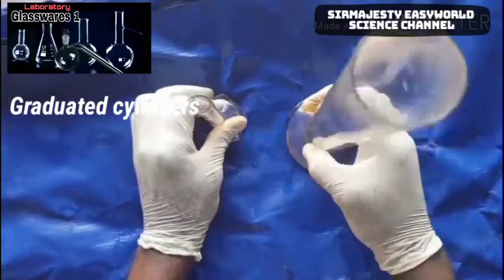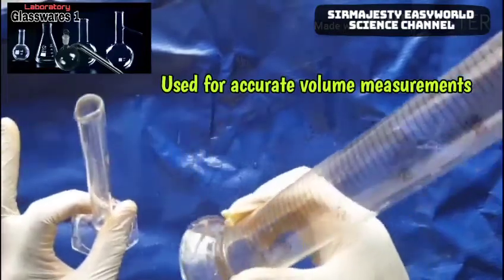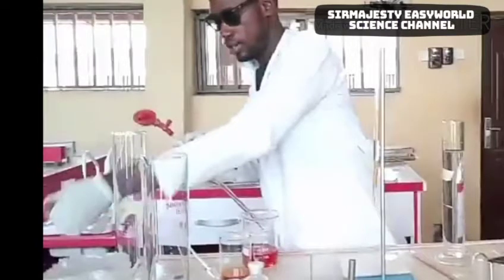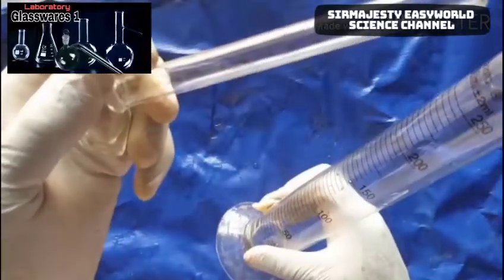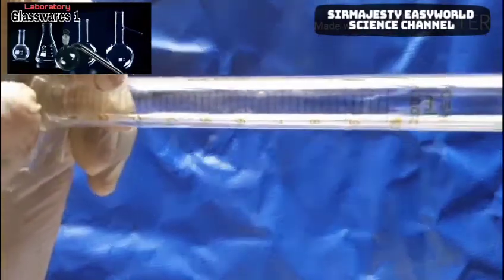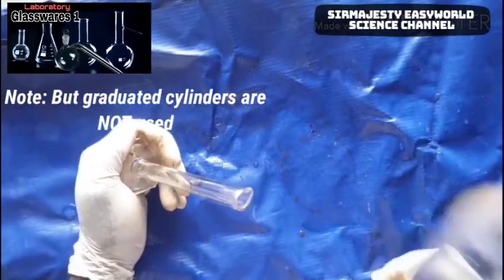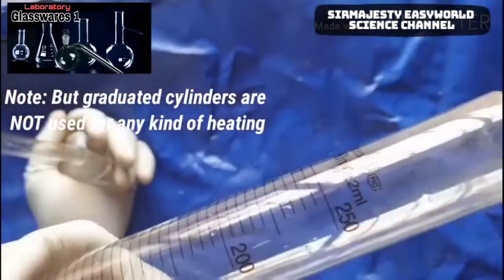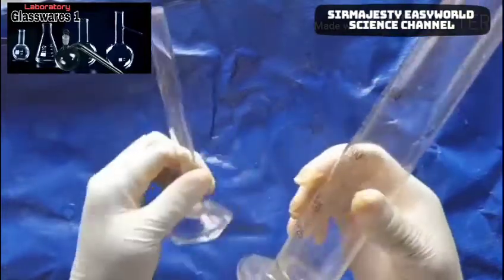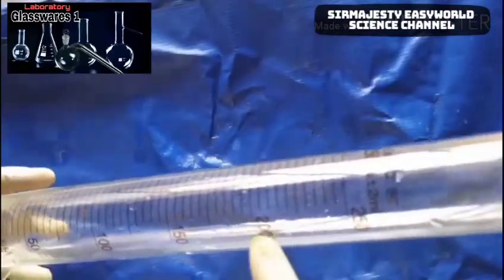These are graduated measuring cylinders, used for accurate volume measurement. Among all the glassware mentioned, the main purpose of these is accurate volume measurement — the precision and accuracy is up to 98%. They come in different volumes and sizes. This small one is 10 ml, while this one is 250 ml; you also have 500 ml and 1000 ml. They can be made of glass or plastic, though this video focuses on glass. You can see the 250 ml and 200 ml marks here.